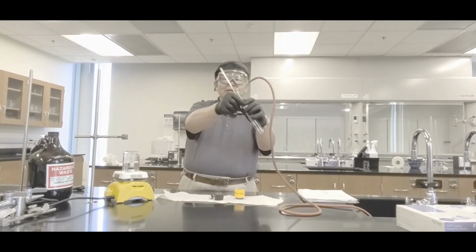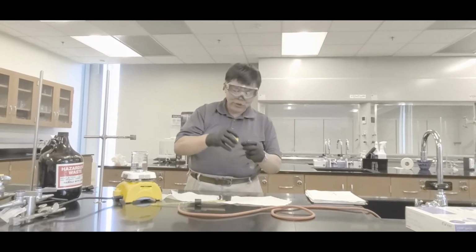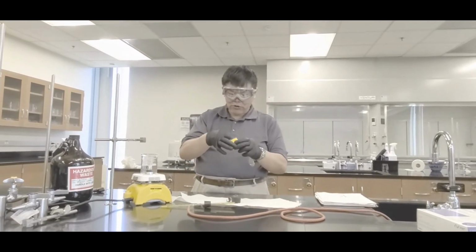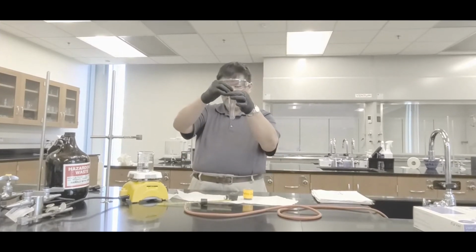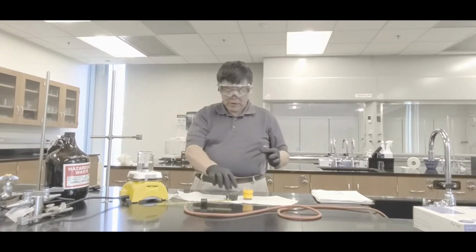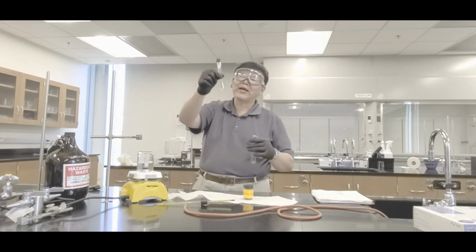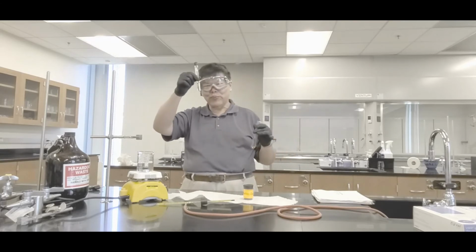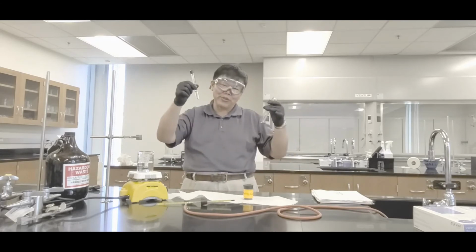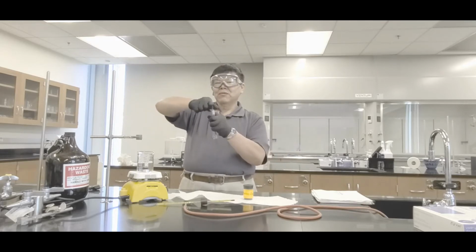And then next thing is this. Take apart the boiling point apparatus. And what you want to do is to go and pinch out 2 or 3 boiling chips. Okay? Park it in there. All right? Then, you know the remainder of that liquid? Hey, you guys, it doesn't matter how much you got in there, okay? Because this is an intensive physical property, meaning it doesn't matter how much stuff you got in there.